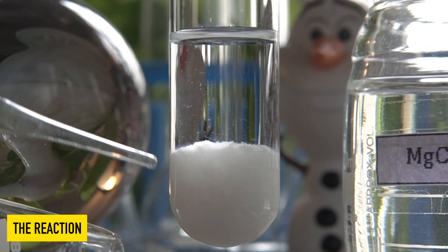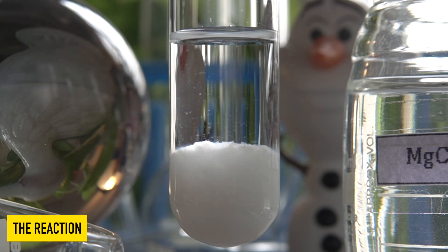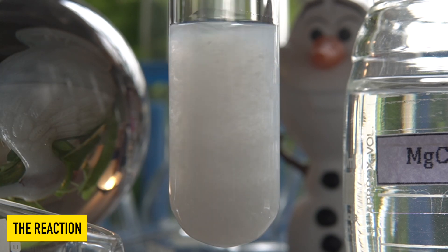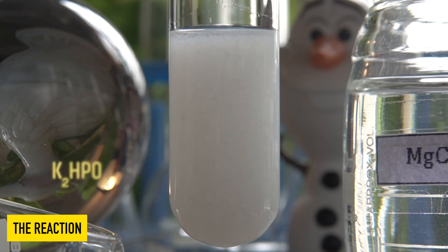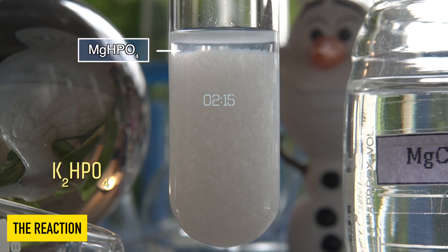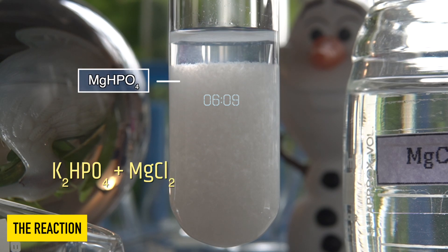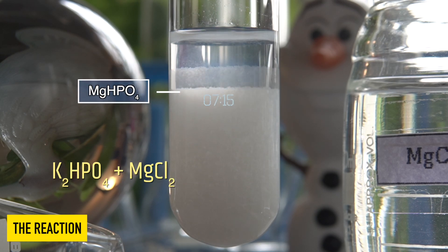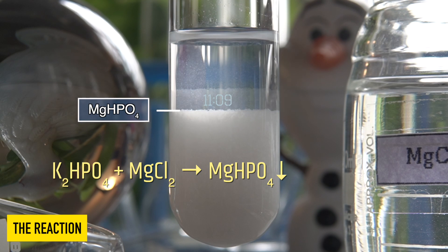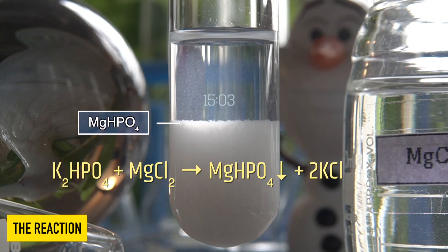The white precipitate formed at the bottom is insoluble magnesium hydrogen phosphate. In this reaction, potassium hydrogen phosphate reacts with magnesium chloride to produce insoluble magnesium hydrogen phosphate along with potassium chloride.